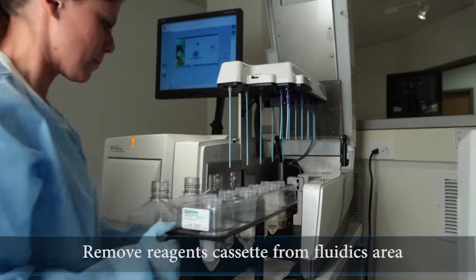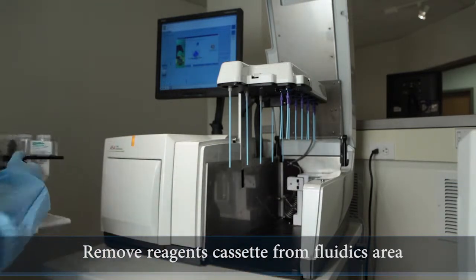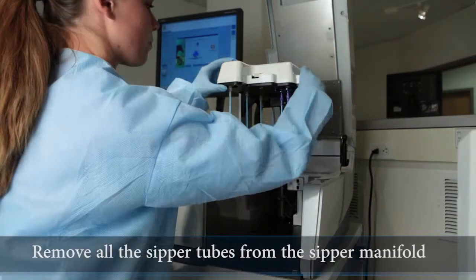Remove the reagents cassette from the instrument's fluidics area and remove all the sipper tubes from the sipper manifold.